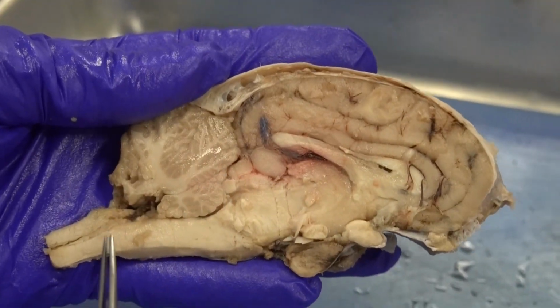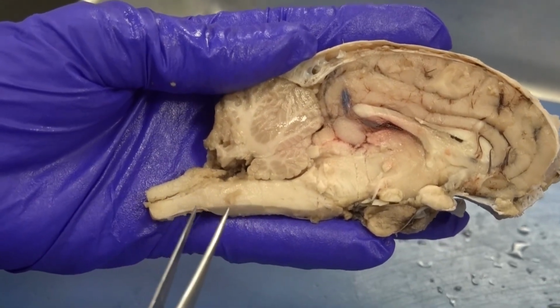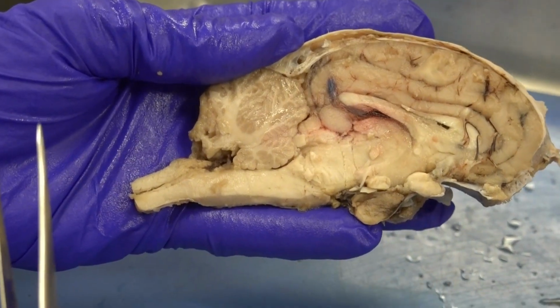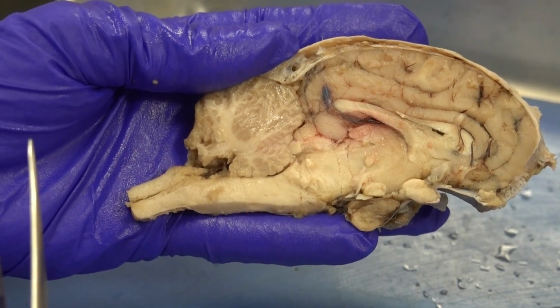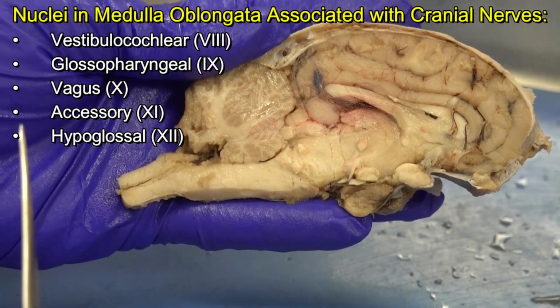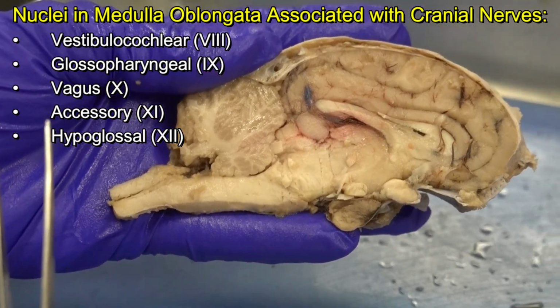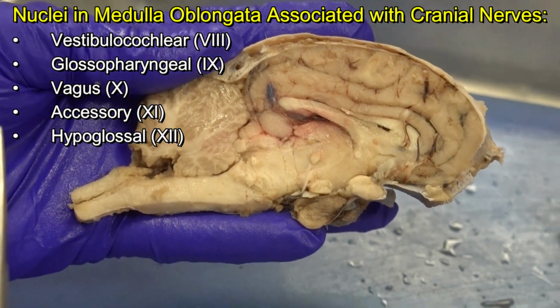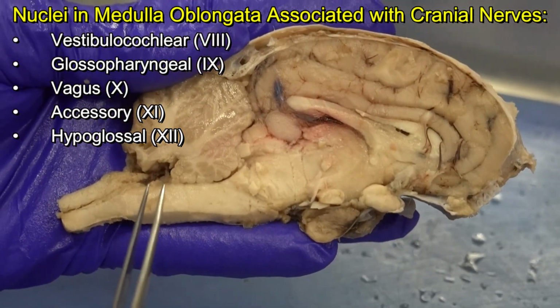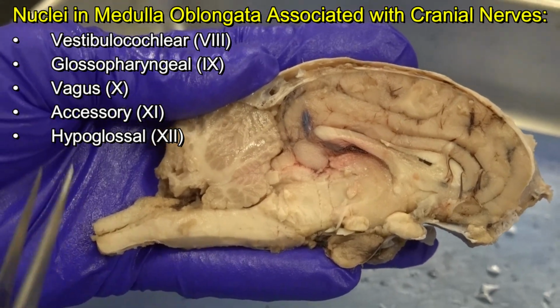Now, I go back again to the medulla oblongata. One important thing to know about the medulla oblongata is that this part of the brain also contains some nuclei that are associated with several of our cranial nerves. For example, cranial nerve number 12, hypoglossal. Cranial nerve number 11, accessory nerves. Number 10, vagus nerves. Number 9, glossopharyngeal nerves, and number 8, vestibulocochlear nerves. So it's not really surprising that those nerves have connections to the medulla oblongata.